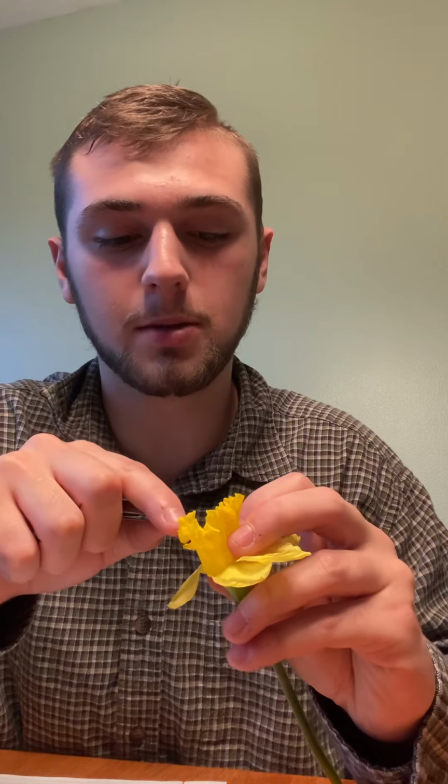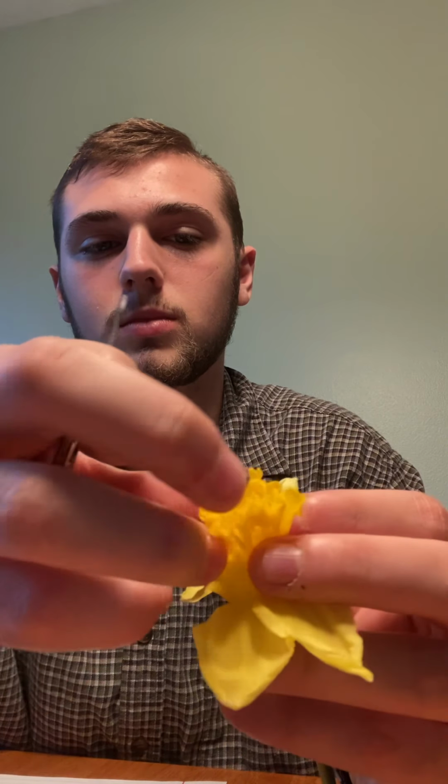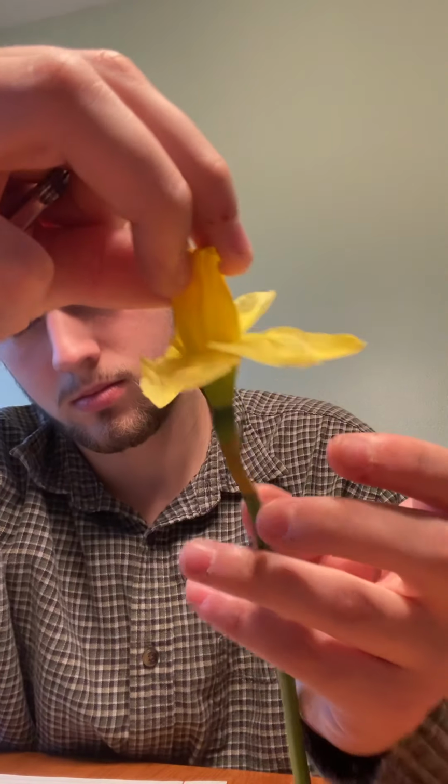These are already so messed up because of the fact that I had to record this video so many times because of my storage. The style is in here. Coming out like that. The goal of the style is to grow the pollen tube.